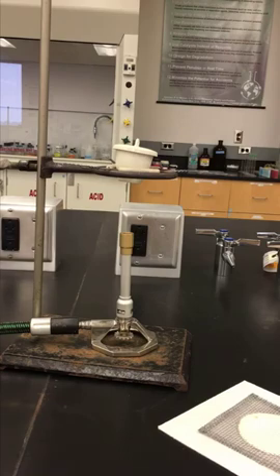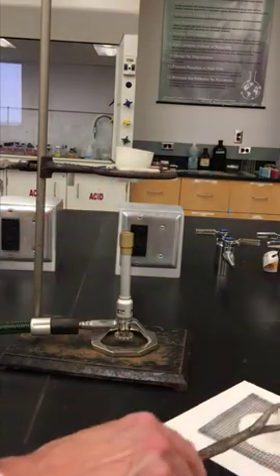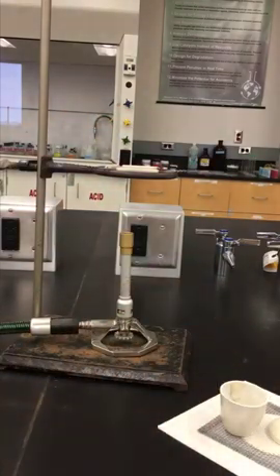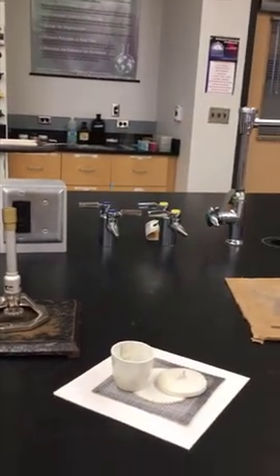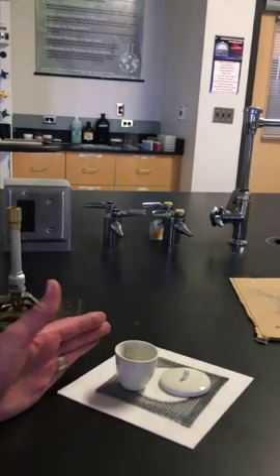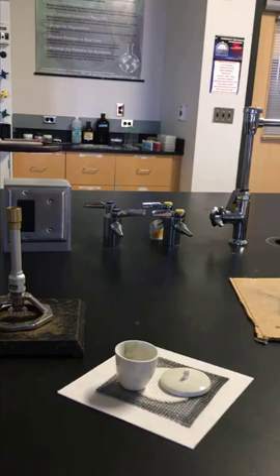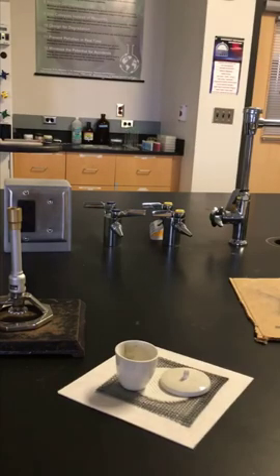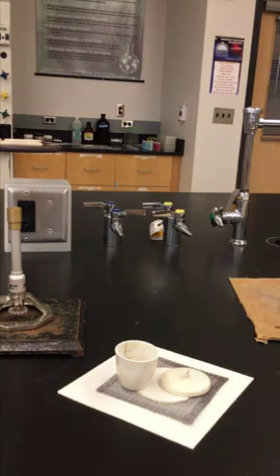So take the lid off. Take your crucible off. Let it cool for a good 12-15 minutes like this because you want it cool. You do not want it hot. You can't touch it with your fingers, but you can put your fingers close. You can see how much heat is radiating off of the crucible itself. And once it's cool, you can measure the mass of your crucible with the lid and your new compound.